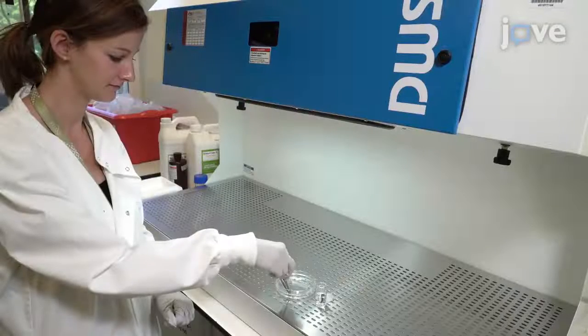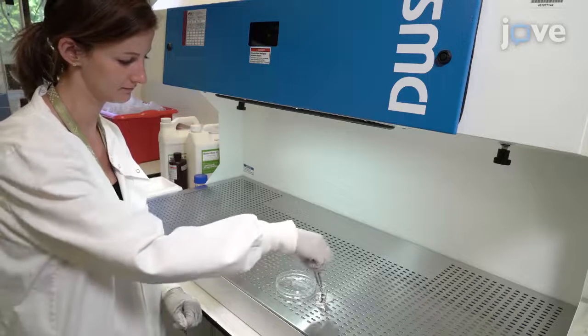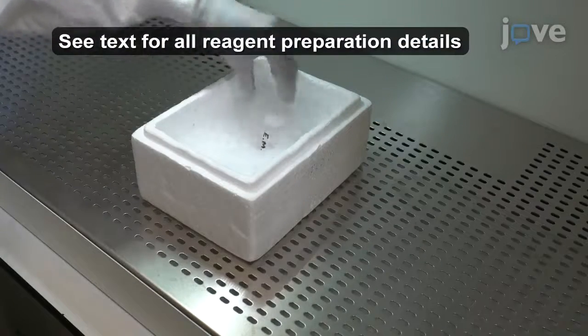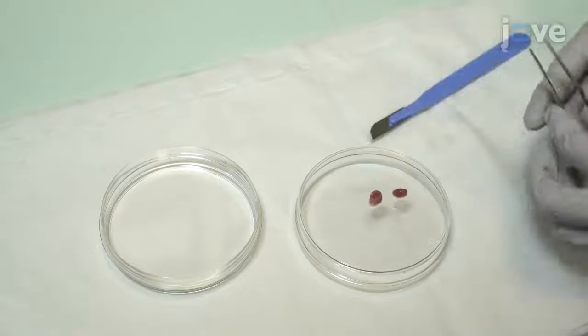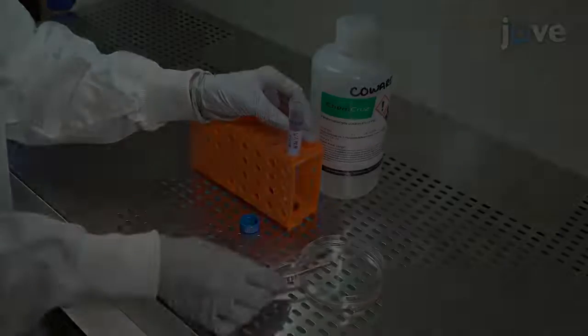Then, place the fragments from each section of tissue into individual electron microscopy vials containing 5 milliliters of 2.5% glutaraldehyde solution and store the samples at 4 degrees Celsius. For histology of the cortical and juxtamedullary glomeruli, remove and fix the upper third of the kidney in 5 milliliters of 4% paraformaldehyde at 4 degrees Celsius.